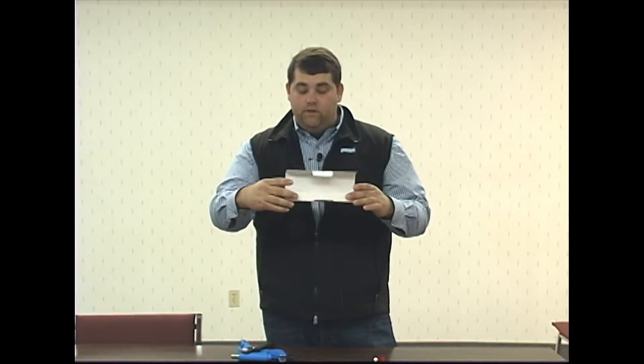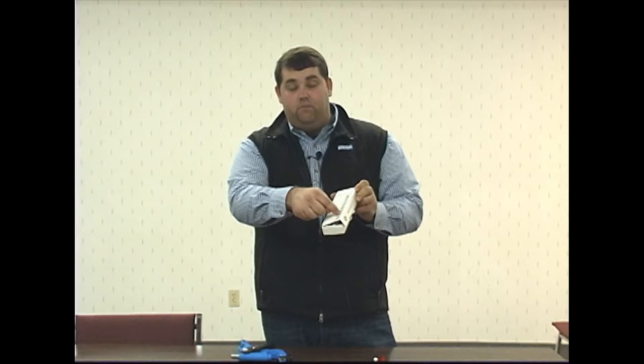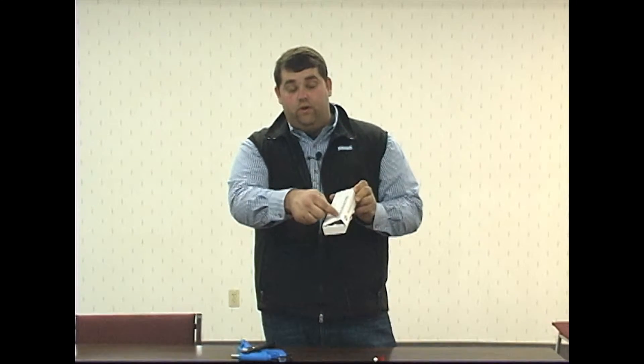The tissue sampler can be placed back into the box where it came from. You can indicate the tag number on the box in the section here. It'll match the barcode as well as the visual number.